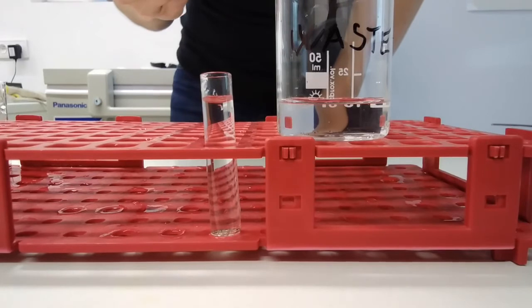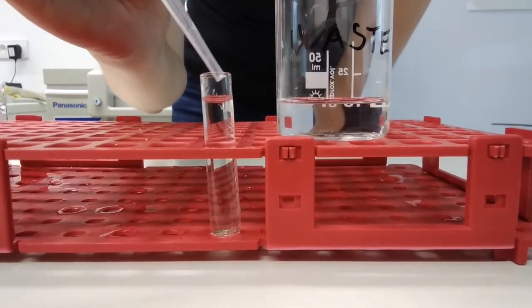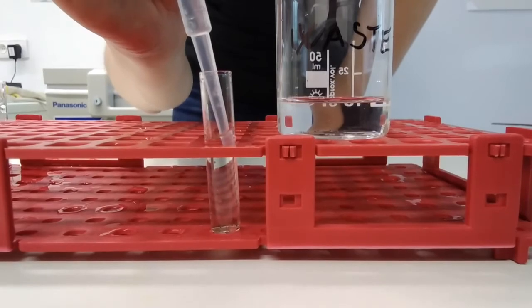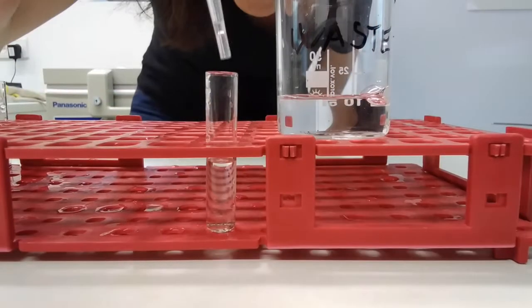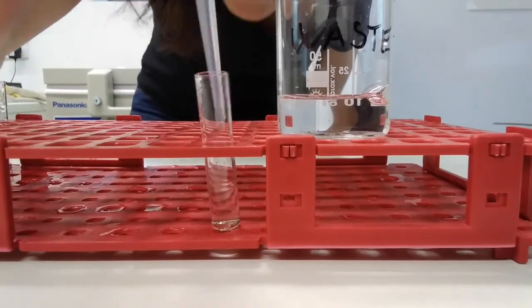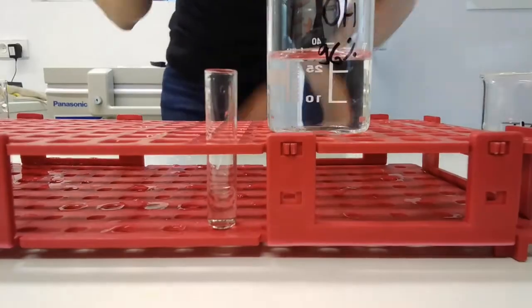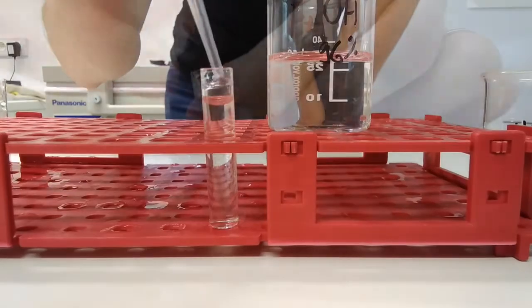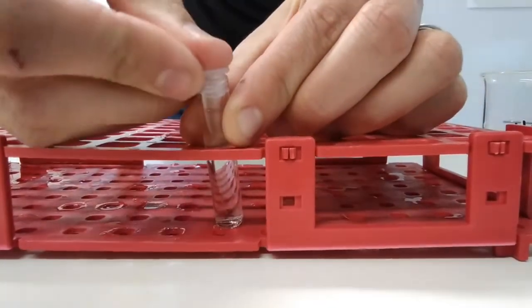Now, when all animals are at the bottom of the vial, we need to replace water with ethanol. We carefully remove three quarters of water from the top of the vial and fill the vial with 96% ethanol. Label the vial and store it in a fridge.